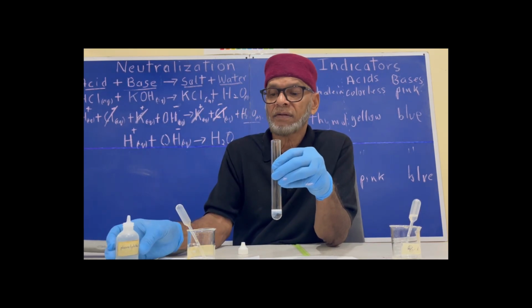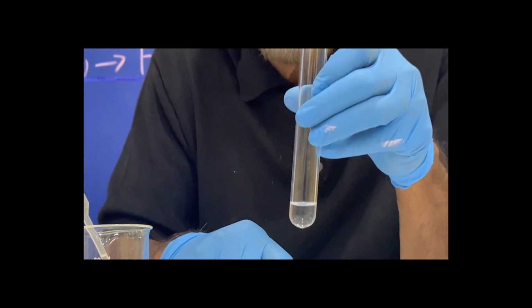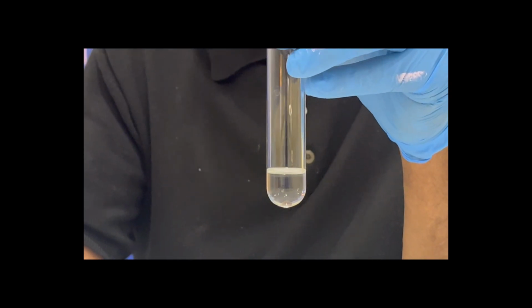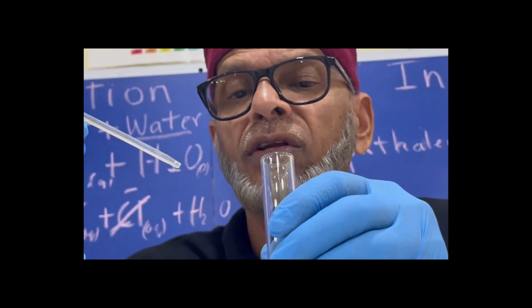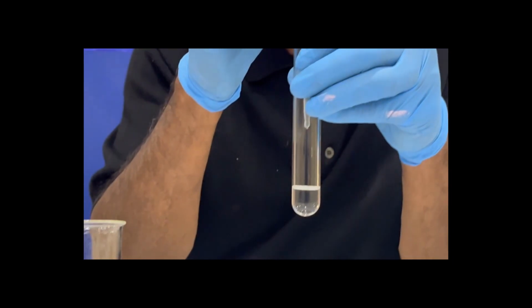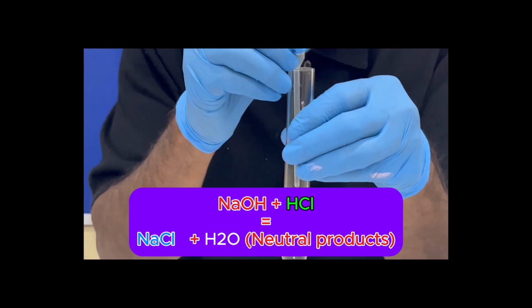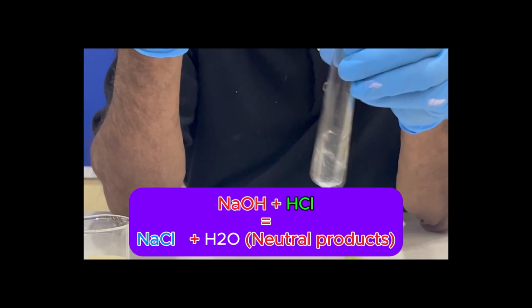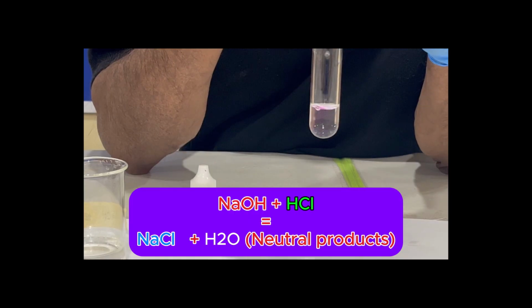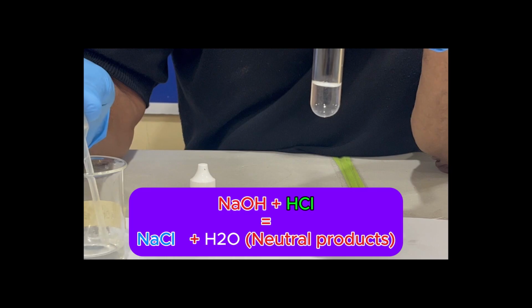Okay. As can be recalled, phenolphthalein in acid is colorless. So gradually what we'll do now, we'll drop some of this base inside of this solution here. The fact that it does not go pink as yet indicates that at this point in time, there is still excess acid inside here. It will not go pink until all the acid has been neutralized by the base. So we keep doing that. See, there's a tendency for it to go pink now. It means that the end point is about to be reached.